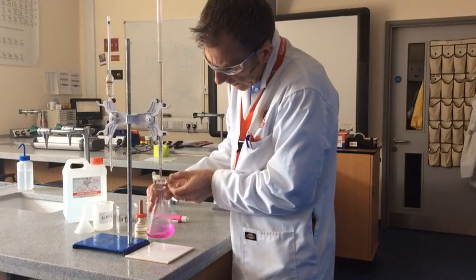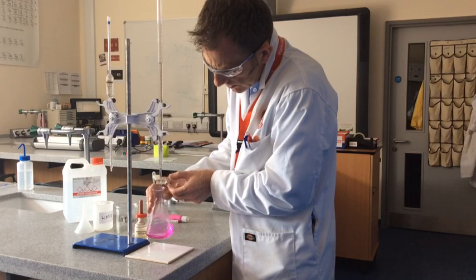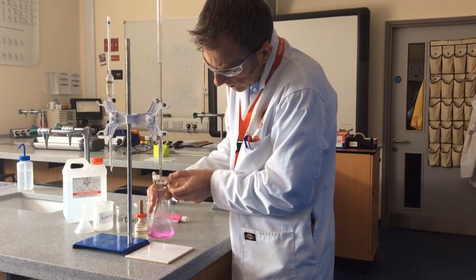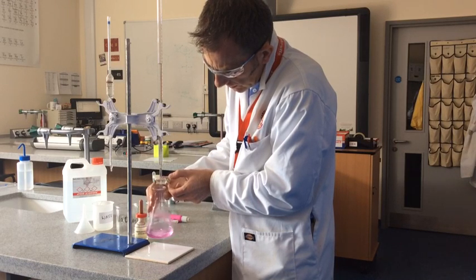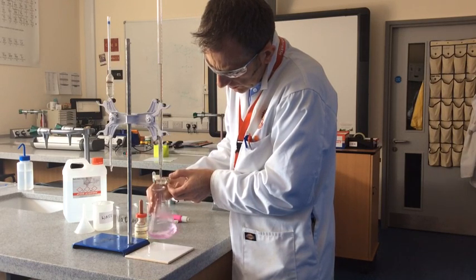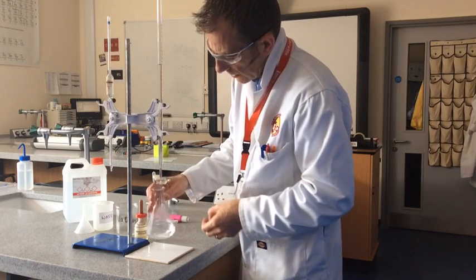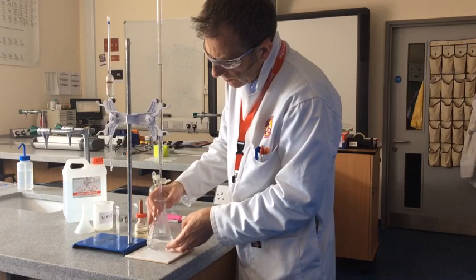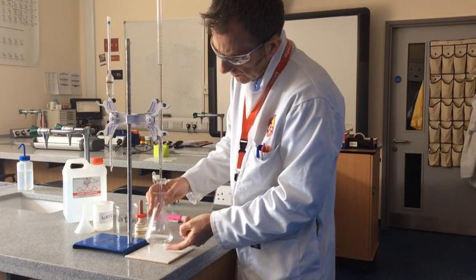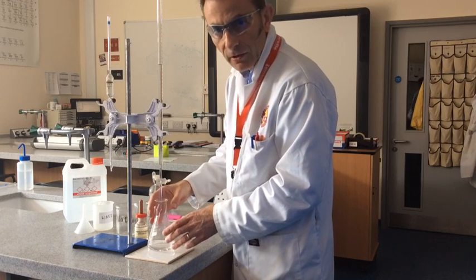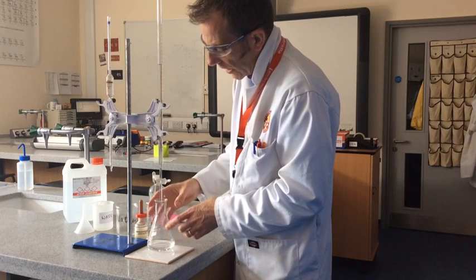So we can see flashes of the clear solution. It's nearly gone. We've got about one drop every couple of seconds. I'm in total control here. I'm looking for the totally colorless and gone. So we caught that very drop there that changed the indicator to colorless. So we'll just have a look at where the burette's at now and record it on our table. And then we'll do another accurate one.